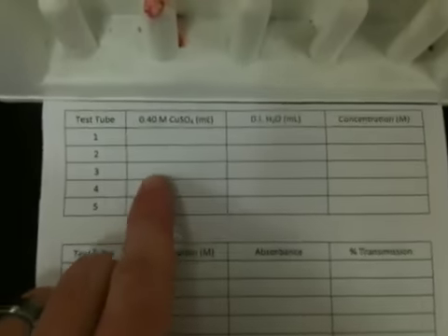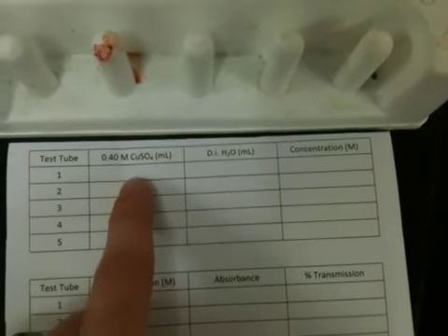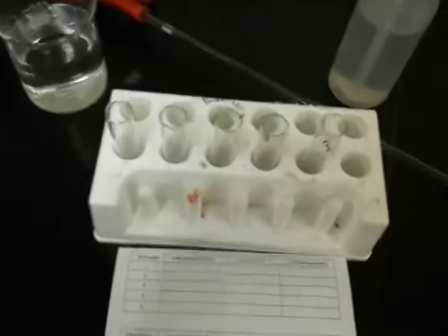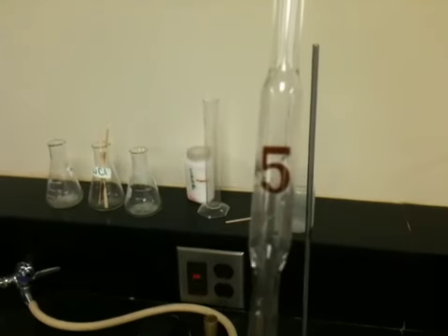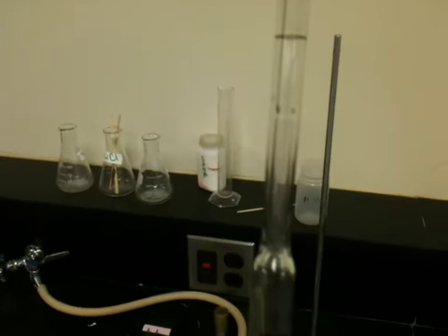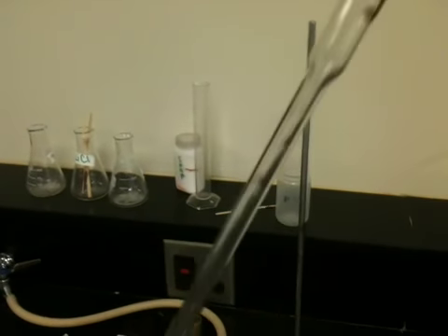So what this table shows you is that you're going to have to pick some volumes of this and some volumes of that. And your first one, I would like you to start with entirely just this and none of that. Now, how do we transfer the liquid? Well, we're going to be using a device you haven't used before. This device is called a volumetric pipet, and it only has a measurement for one volume. It says 5 on it, and at the top it has a line. When you fill it to that line, it's exactly 5 milliliters, or at least it's much more precise than other equipment like a graduated cylinder you see in the background back there.